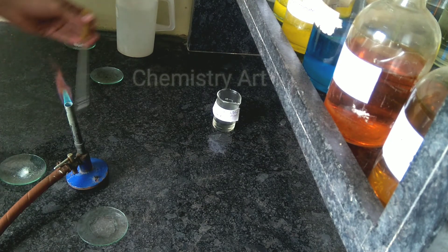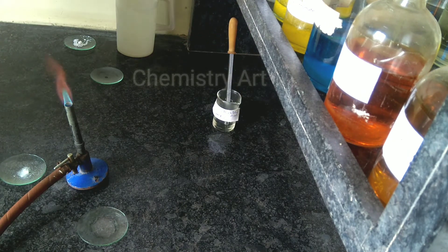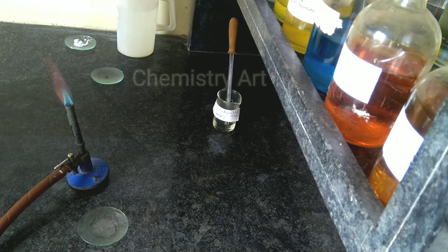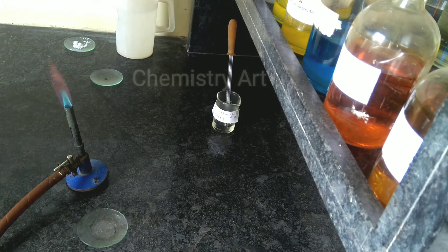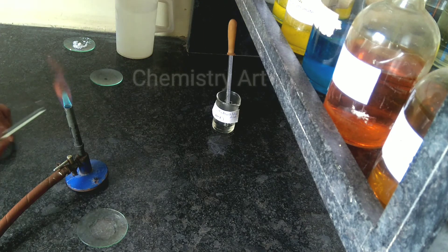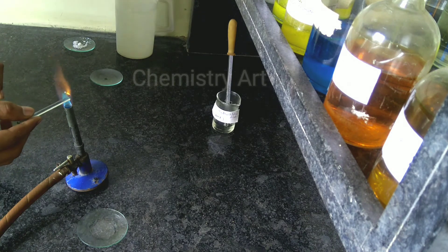I have added concentrated hydrochloric acid into the salt, so now this is paste. I am going to dip my platinum wire into it and let's check out the flame. Here you can see the green color.